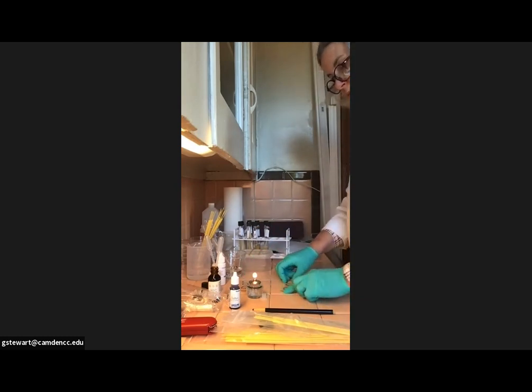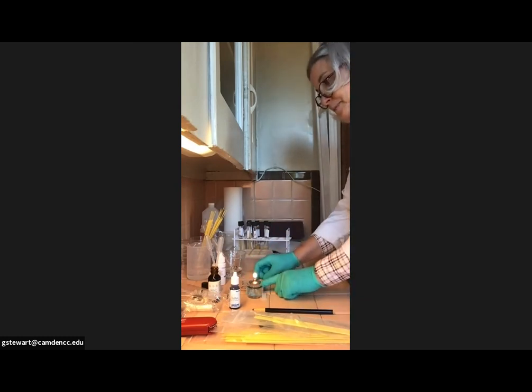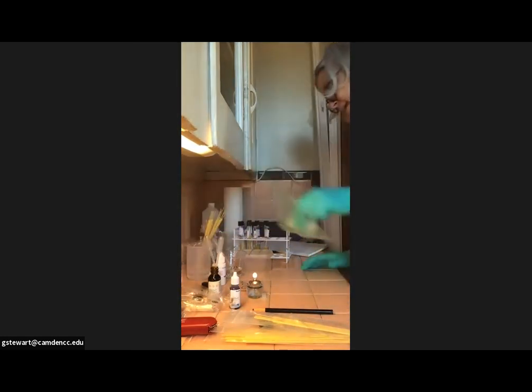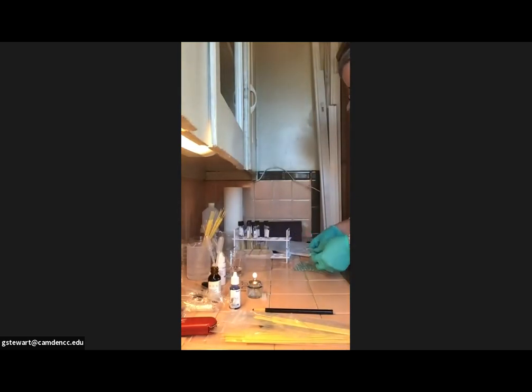They're SS1 and SS2. And I am going to go ahead and prepare the slides for the Gram stain as well. So your instructions are very specific for the Gram stain slides. They require you to make 4 slides so that you have all the different combinations of bacteria. So I'm going to get out 4 more slides.